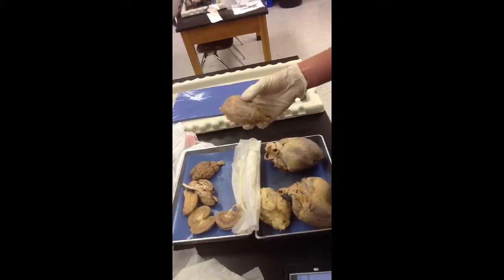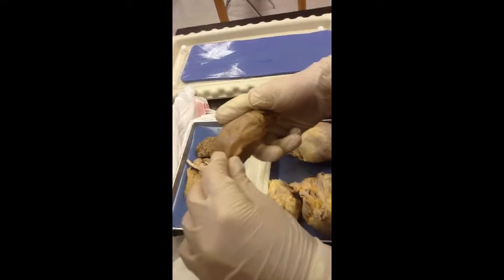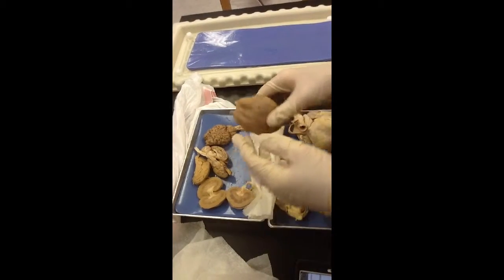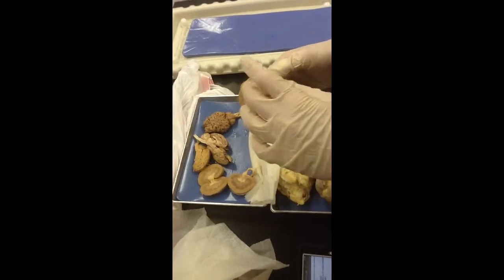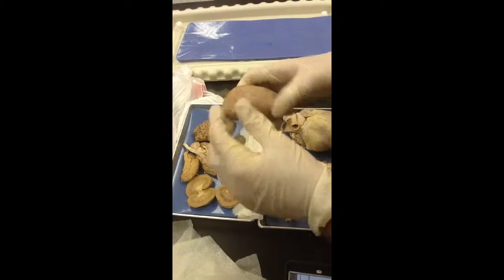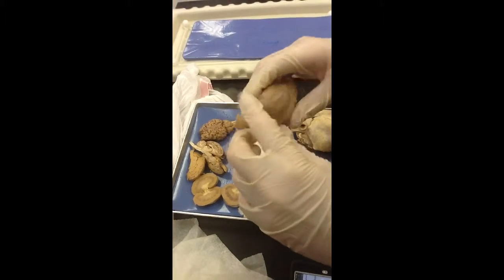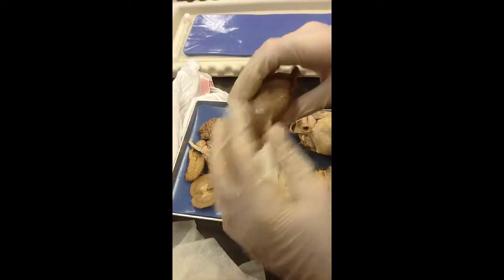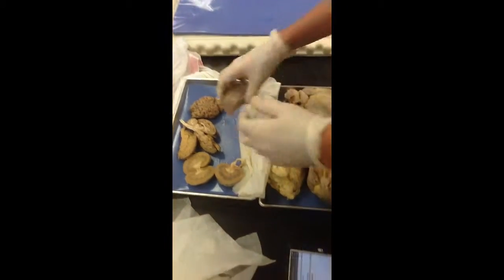All right. Okay, so these are the meninges. It's like this layer outside of the brain, kind of holds it in place and protects it. On top you have the dura mater, which is more for protection, the arachnoid mater, and the pia mater, which you can see under here. You can't really see it, but it's under here. This is the dura mater on top.